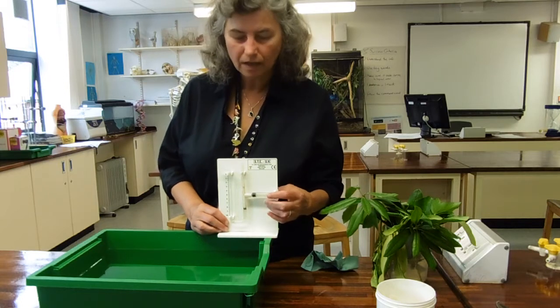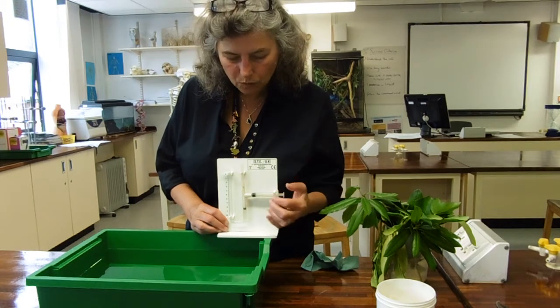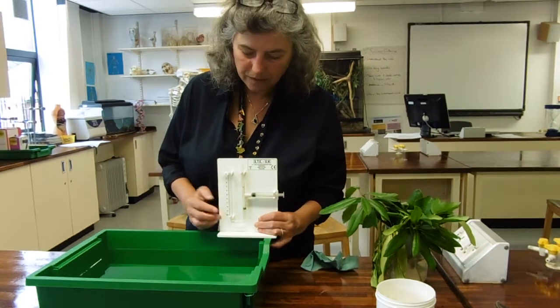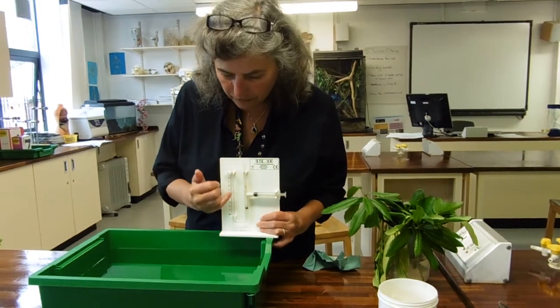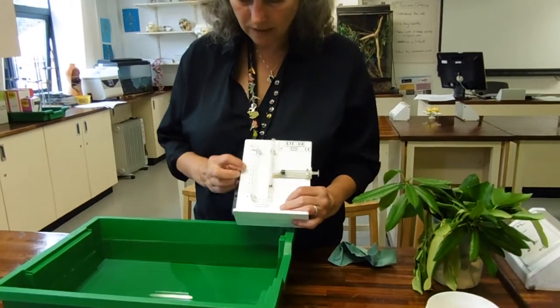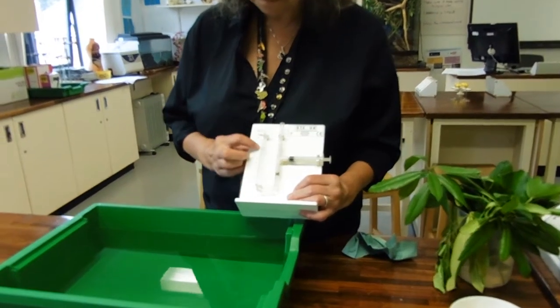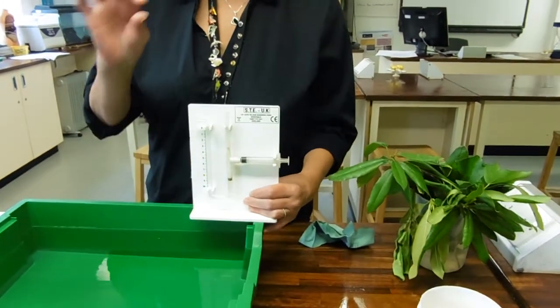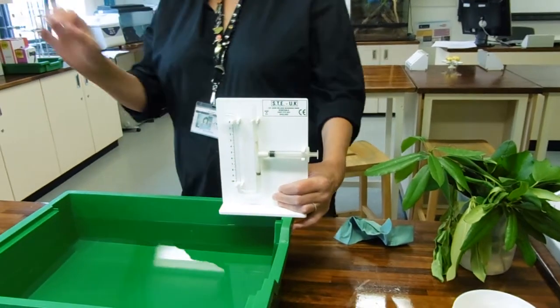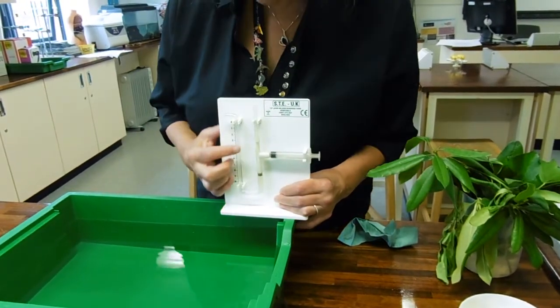They've all got a reservoir — that's just so that you can put some water in there and reset it back to zero. They all have a capillary tube of some description with a scale on it somewhere. Our scale is down the side on this one, but it could be a horizontal scale or a bit of clear tape with a scale on it, but it needs a scale on it.